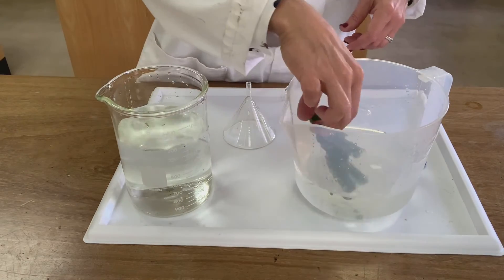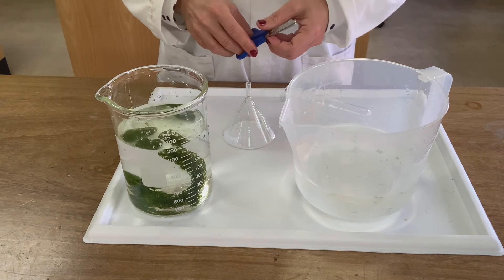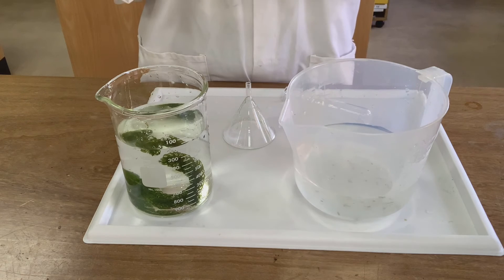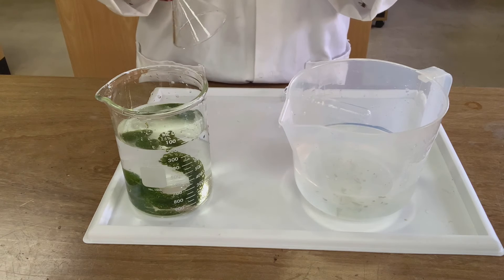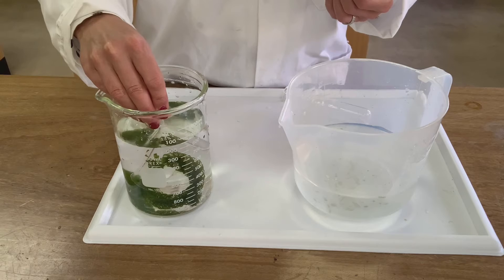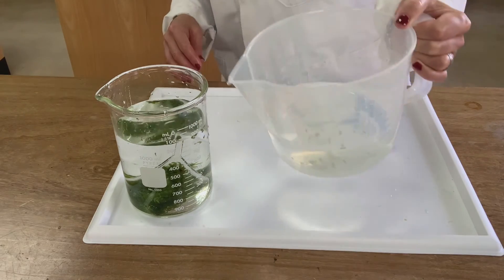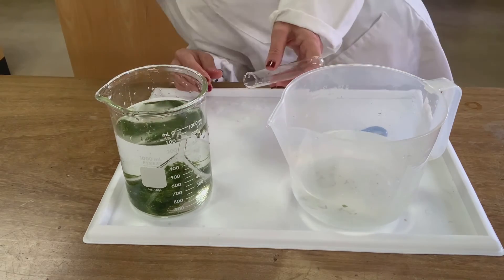We're going to take the pond weed and put it into the beaker of water. To make sure we can see the bubbles of oxygen being released, we need to snip the end of the pond weed off, because otherwise the cut end will have sealed over from being exposed to air when it was collected, and so it won't release oxygen. The cut is made underwater so it doesn't seal over again, and then we place the glass funnel over the top to hold that cut end upright, making sure there's enough water to cover the tip of the funnel, to focus the bubbles up into a boiling tube.